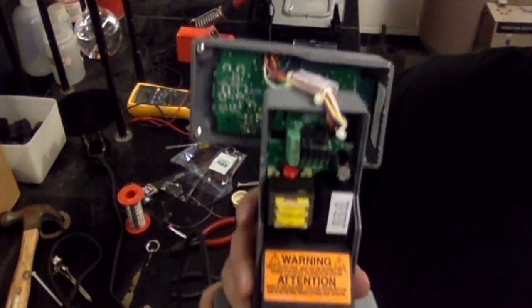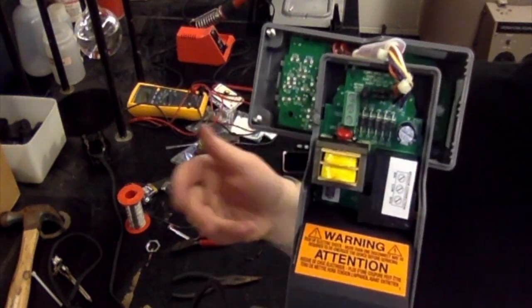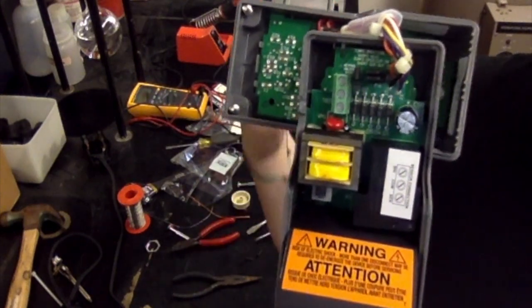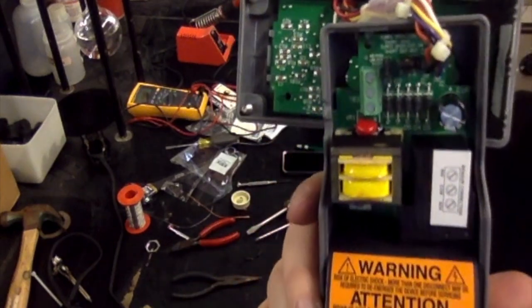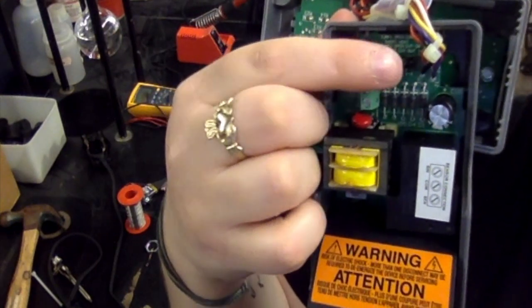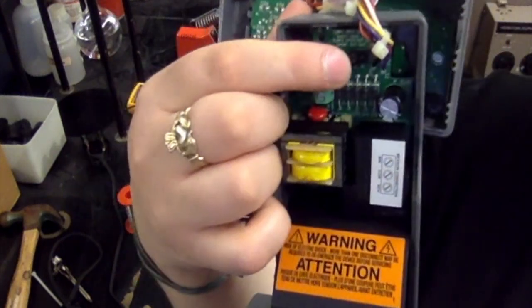So this is going to be a little bit tricky to see from the video, so if you're having issues deciphering what I'm trying to do, I would highly recommend looking at the file, because I believe it's a lot more clear. I put pictures in, and I think it's straightforward. But I'm going to go ahead and try to explain this on the video. So if you look at the top, what you're going to see is 3 prongs. One of them is up and down, and then there's 2 parallel ones that are to the right. Yes, the right.